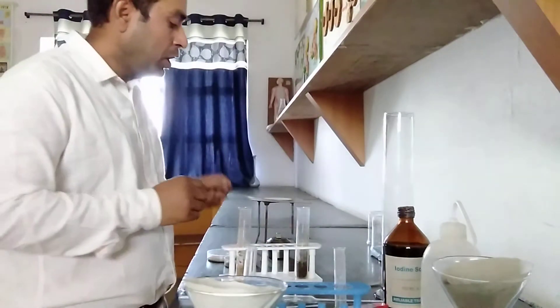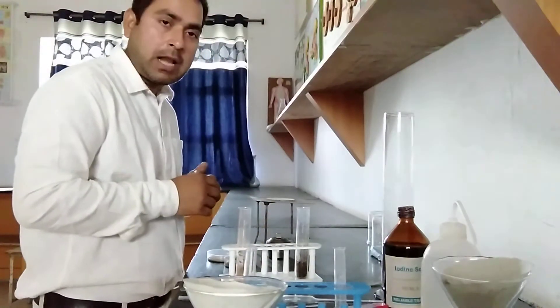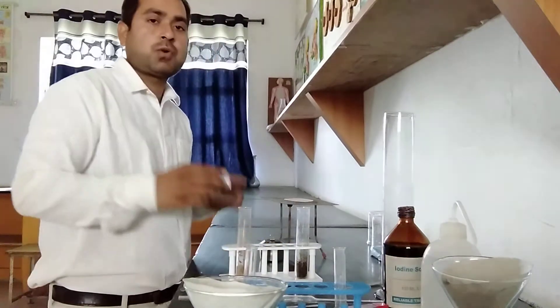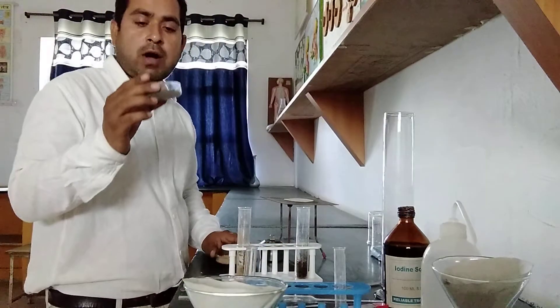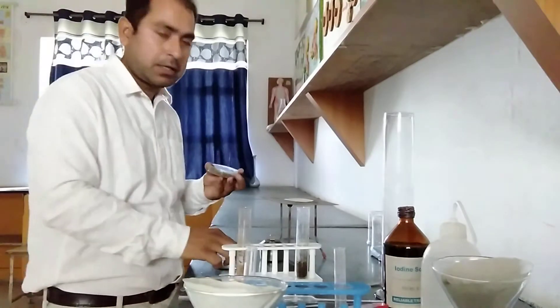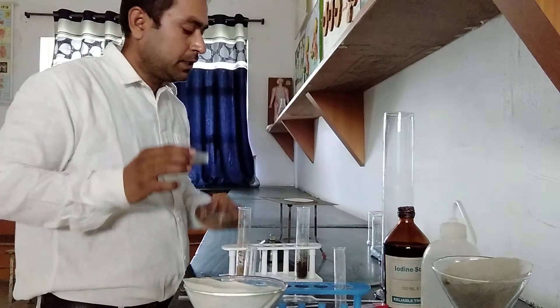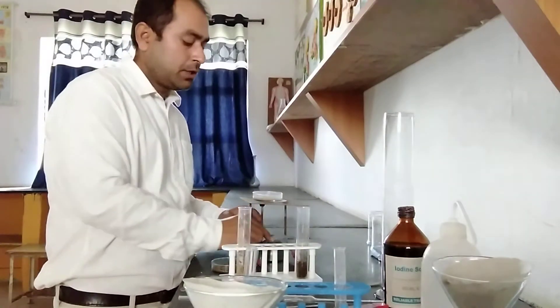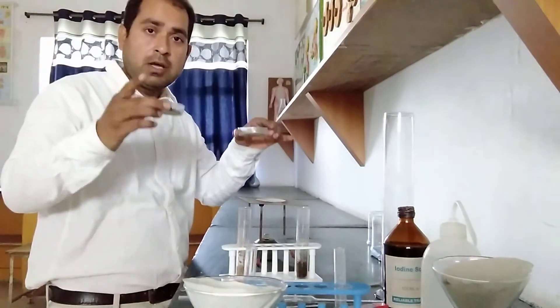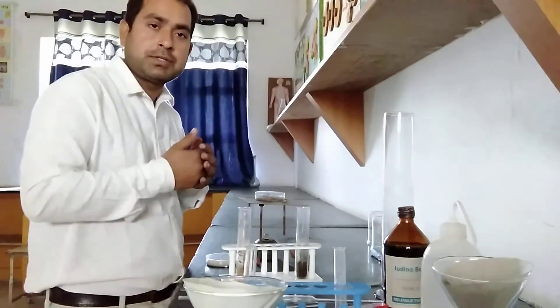Fourth, what you have to do: you have to check the moisture of soil. For moisture of soil, you require a Bunsen burner, a stand, and your target soil. Here I have used the target soil. Suppose it is having some water content — the water amount present in your target soil is also measured in weight. So what you have to do: you have to first measure the weight. After measuring this, you have to apply heat using the Bunsen burner. After providing equal heat for both soils, you can check the weight again, and now you can find the moisture of this soil.